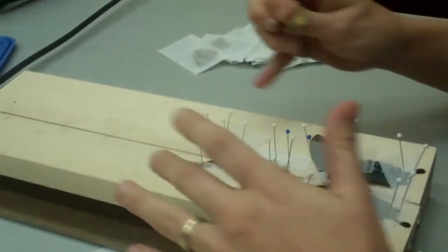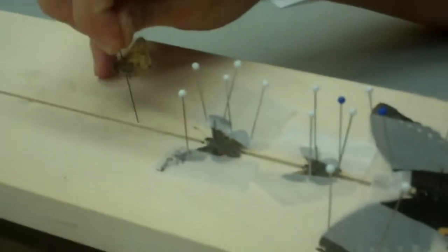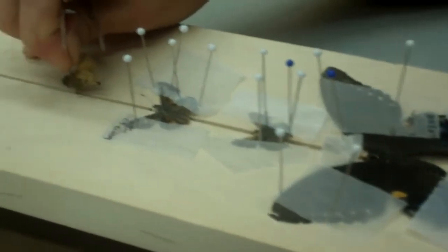This is my pinning board and as you see, I've already done a couple of them. And I'm going to put it right in the middle and push it down to where the wing joints are.